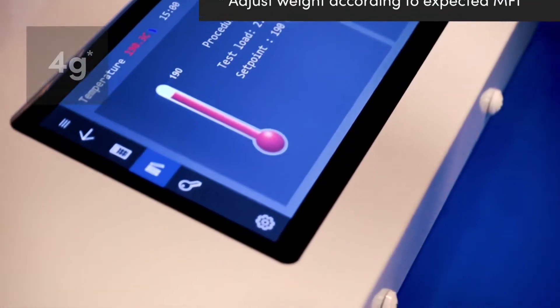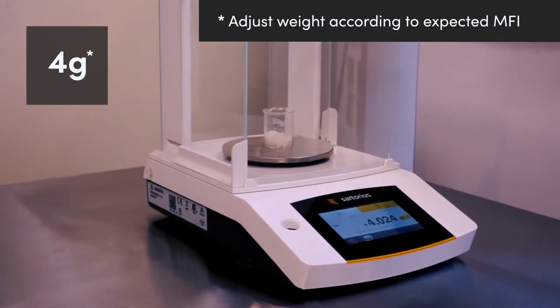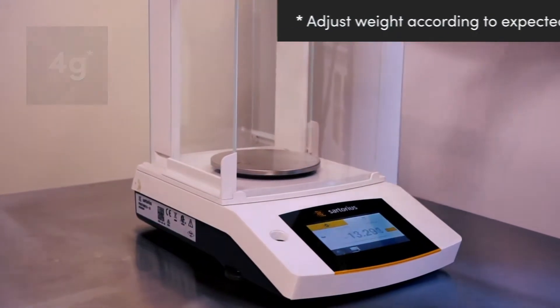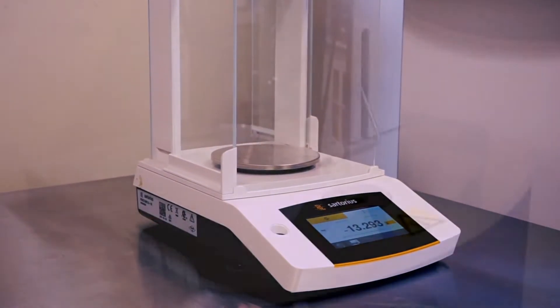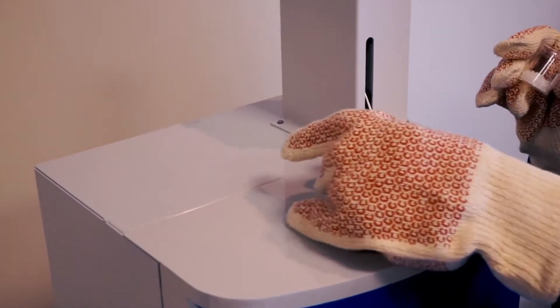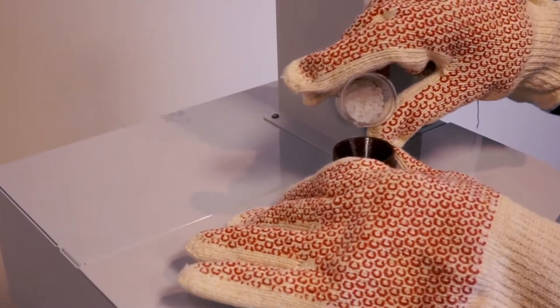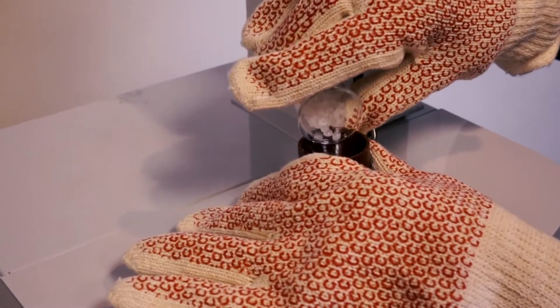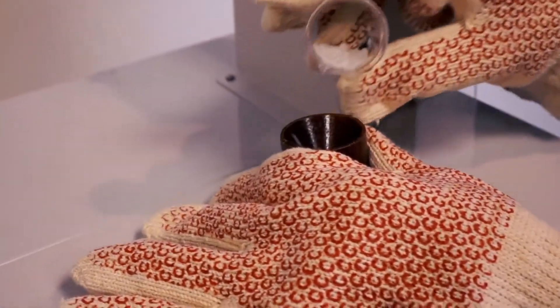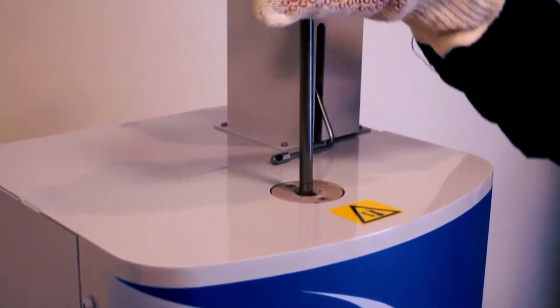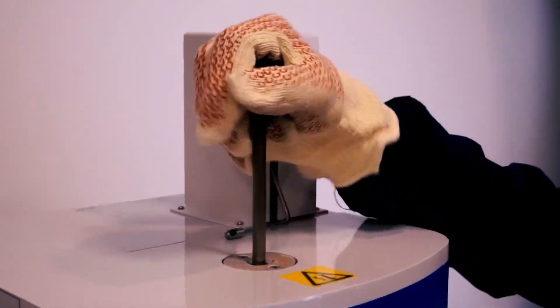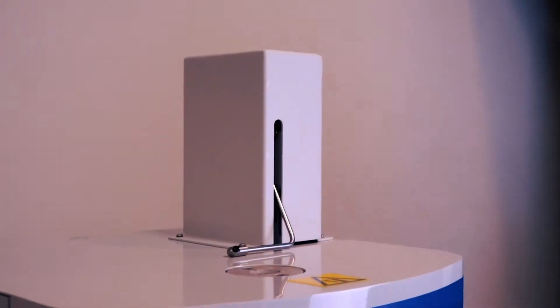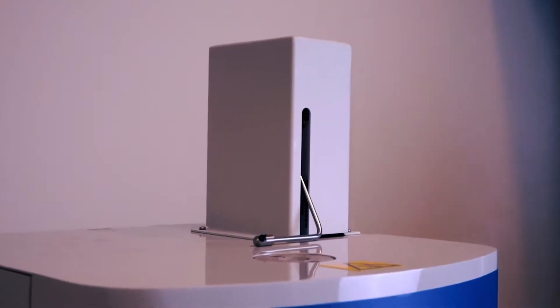Next, 4 grams of polymer is weighed and manually packed into the barrel of the LMI 5500. The operator uses the funnel included in the toolkit to aid in filling the barrel chamber. A manual packing device is used to compact the material into the barrel, reducing space between pellets and ensuring the polymer is uniformly melted.